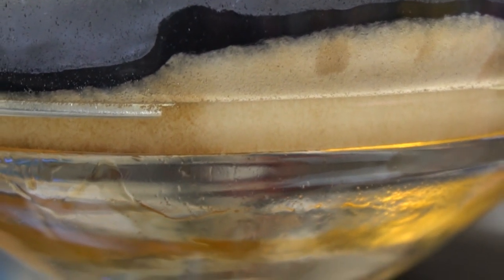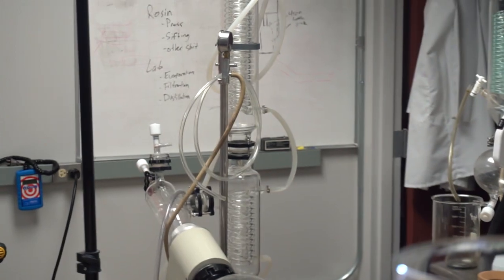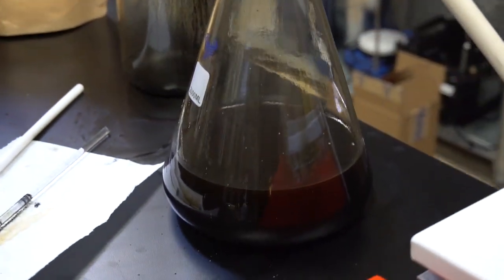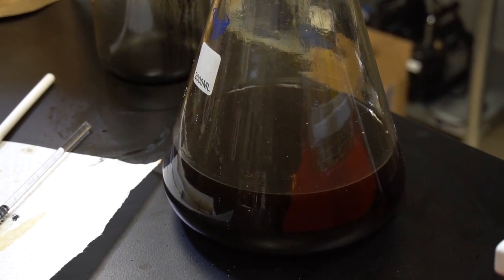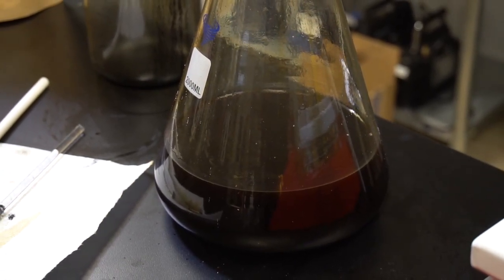But you can do this process multiple times and then after that you can take it to the rotary evaporator we have one set up over there to take out the ethanol. And then after that you can bring it into chromatography stage or you could bring it into your short path distillation. In your short path distillation you can use some more filter media and get all the contaminants out of your material and get the best product in the end.